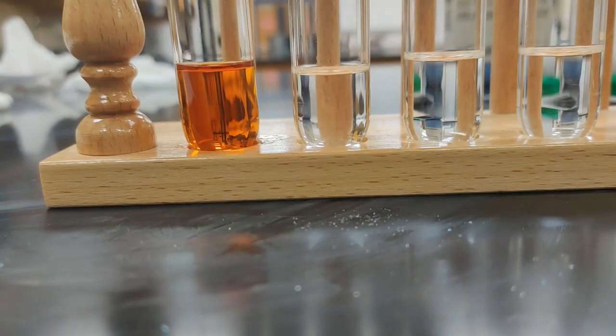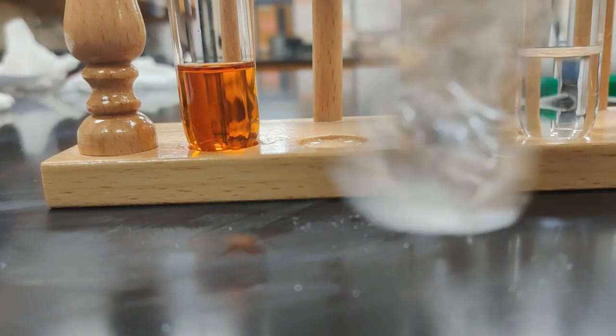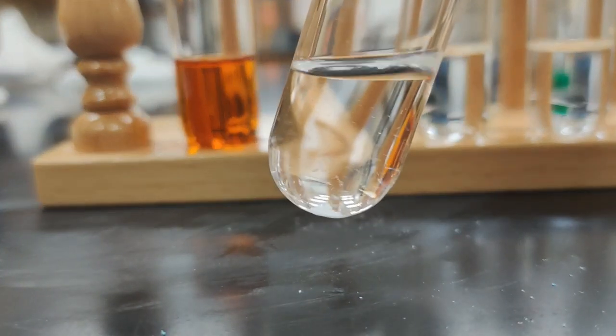Okay, so the next thing we're going to do is ammonium chloride. So again, we just want to use small amounts because we don't want to overwhelm the ability of our solvent to dissolve at all. So I'll put just a little bit on the tip of a scoop in there. You see the solid falling down through the ethanol, but we want to give it a fair shot. So we're going to agitate this. And I still see the solid down at the bottom, especially as I agitate. We can really see that solid swirling around.